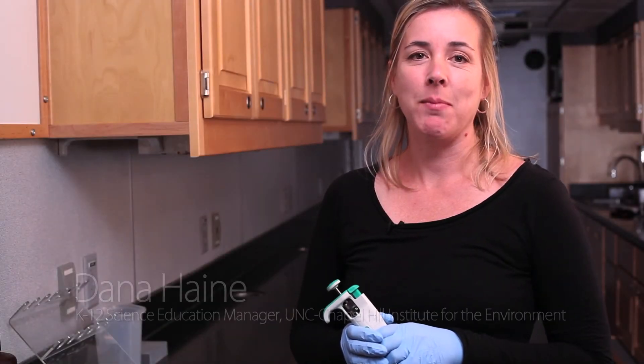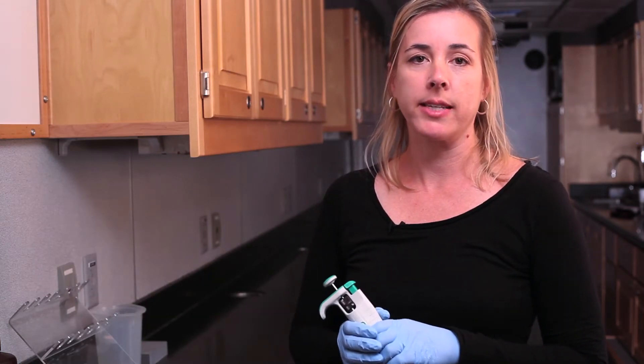Hi, my name is Dana Haine. I'm a science educator with the Institute for the Environment at UNC Chapel Hill and a former science educator with the Destiny program, and today I'm going to show you how to load a protein sample onto your gel.